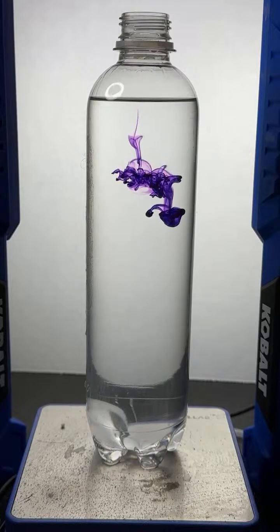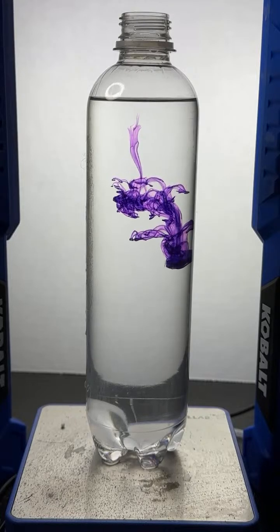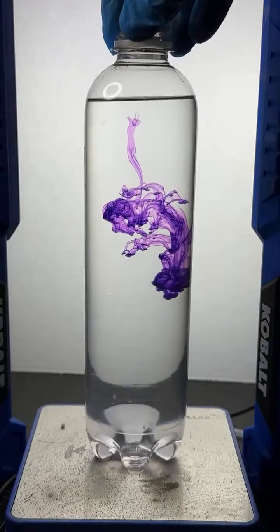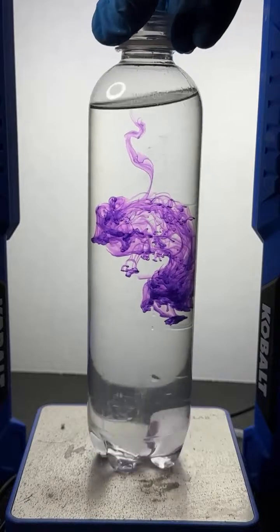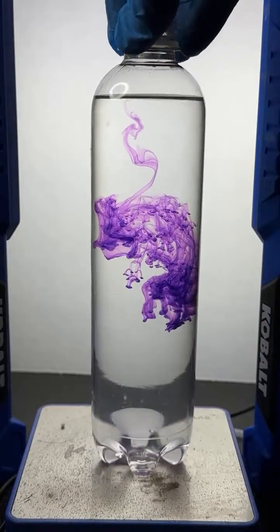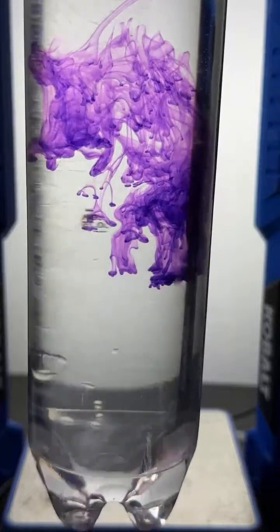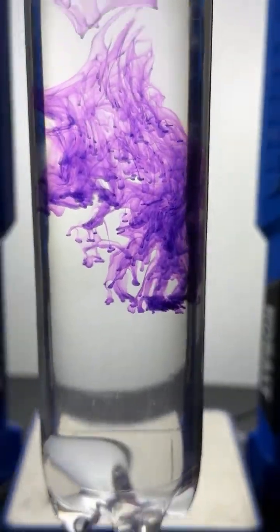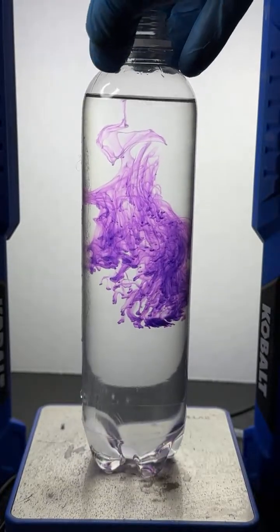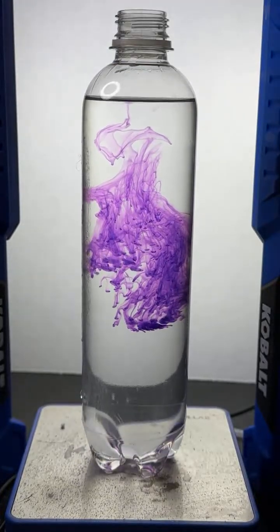Oh, look at that. Look at that gorgeousness. Look at the food dye just going down in there. Just pretty. Absolutely gorgeous the way that mixes in. Isn't it? Look at that. It's just a thing of beauty. I agree, Shrey. I think we're going to give this a shot, okay?